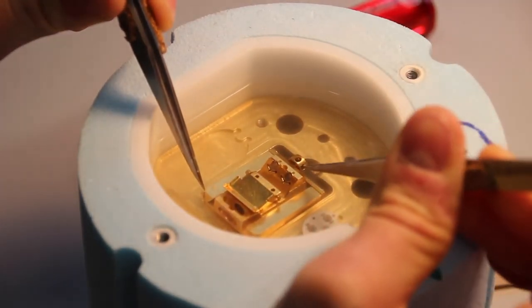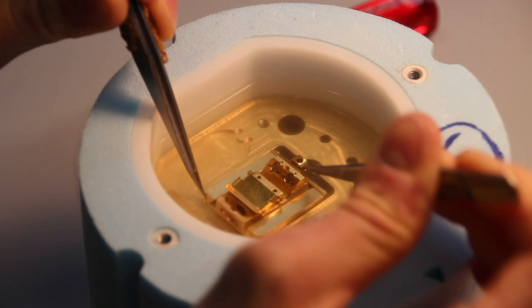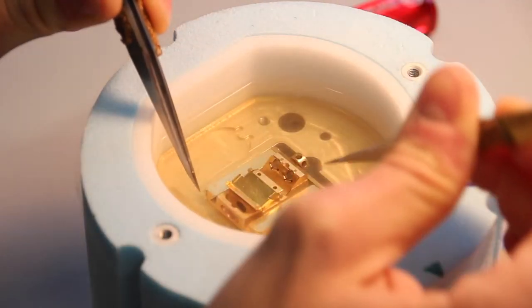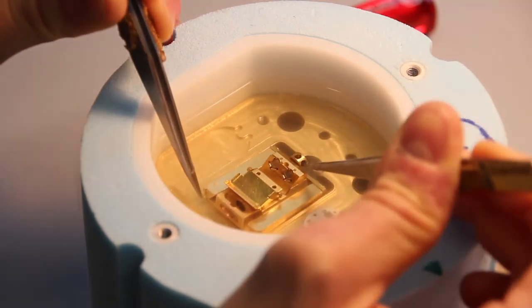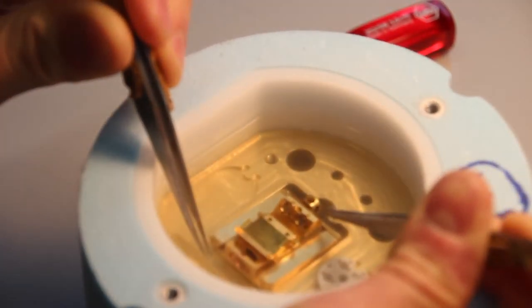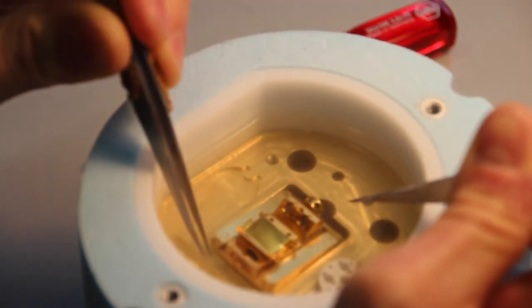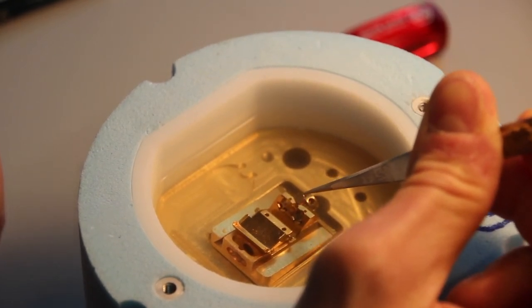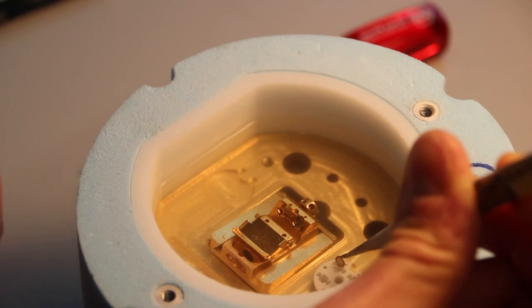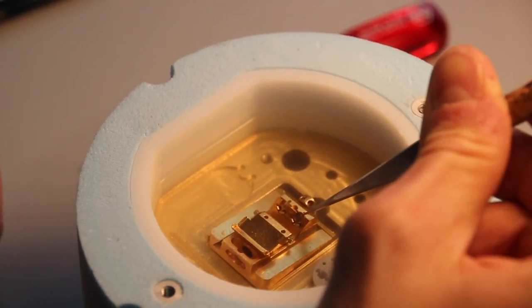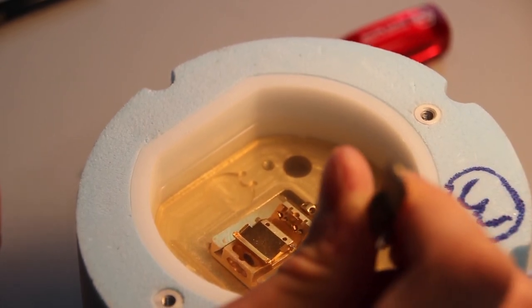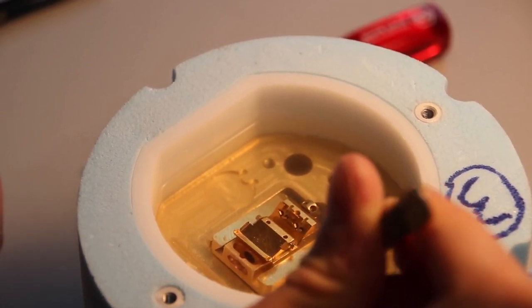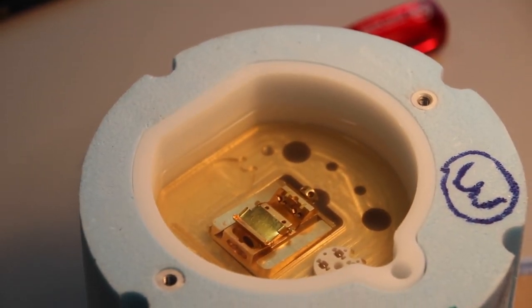Tighten this screw, which will loosen the clamps. While the nitrogen is warming up, you only have a little bit of time before the bubbles come back. If you're lucky, you can do this transfer before it bubbles over again. At this point, it's probably easiest to grab the grids from the top. There you go, all done with your lamella except for imaging.